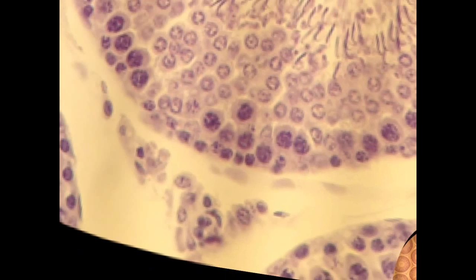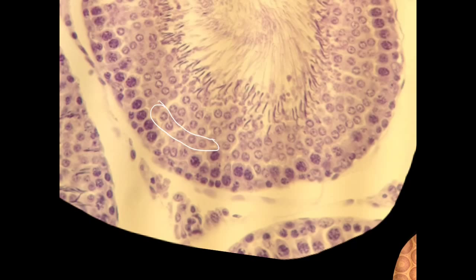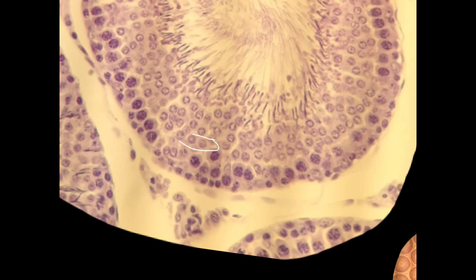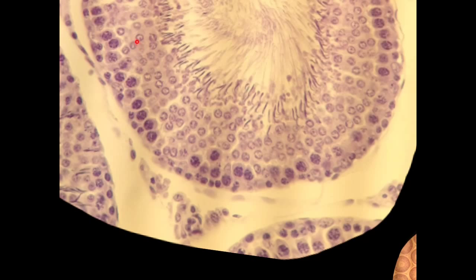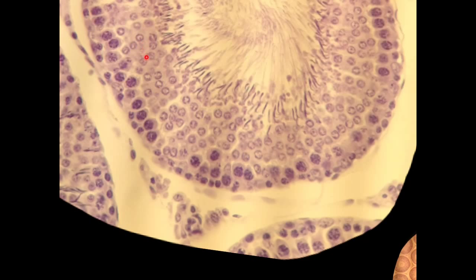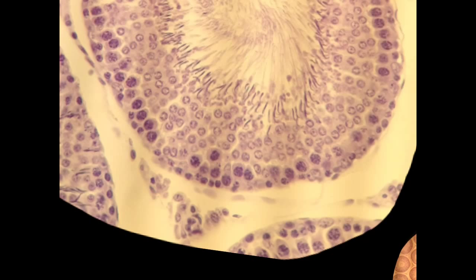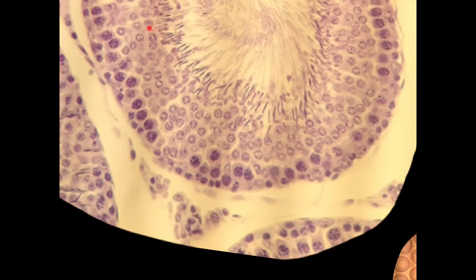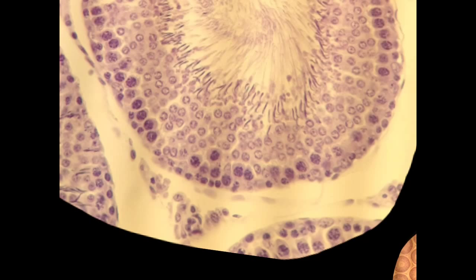The distinction that's a little more opaque is the difference between secondary spermatocytes and where the spermatids begin. Visually, it's a little too difficult to tell the difference, so we'll use a geographical rule. Basically, from the halfway point inward, anything in that inner region is going to be spermatids. The difference between spermatogonia, primary, and secondary spermatocytes all happens in the exterior half of the seminiferous tubule. Anything in the inner half we'll just call spermatids, and those spermatids are on their way to becoming spermatozoa — baby sperm that go off to the epididymis to mature a little bit more.